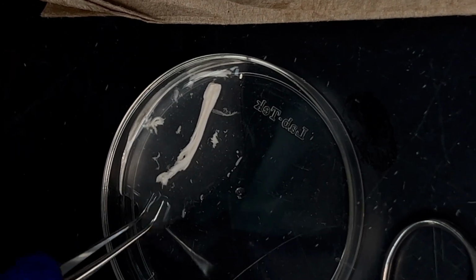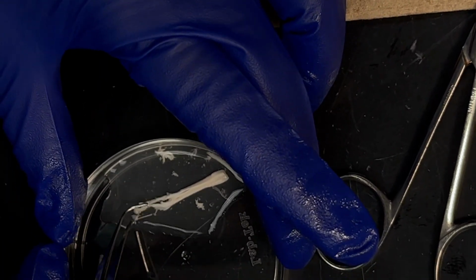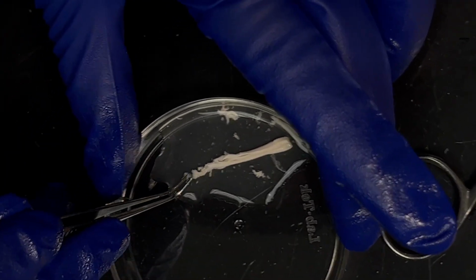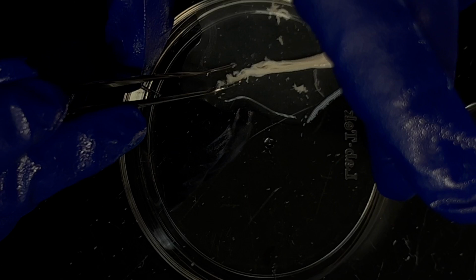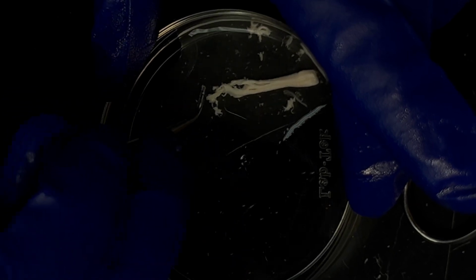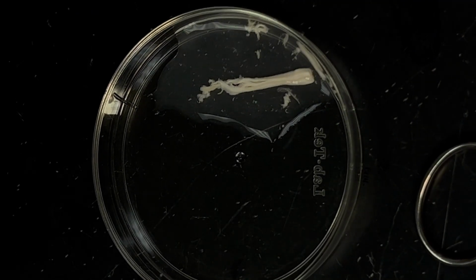But anyway, since it's broken, if I have to collect the tissue, this is where I'm gonna cut, if I can straighten it out just a little bit. This is exactly where, if it was real nice tissue, you see how things get thin here, and this is where the largest part is, where the lumbar enlargement is. So I'm gonna cut right before that, because this is L3 or 4. Then I'll also cut right here, because after this is the sacral region, and then cauda equina.